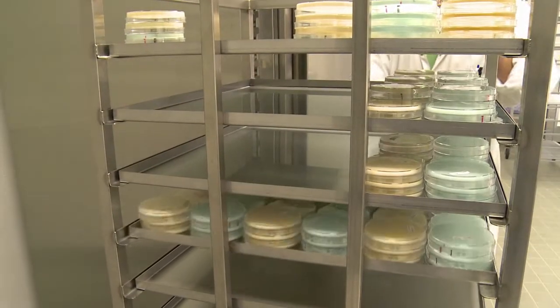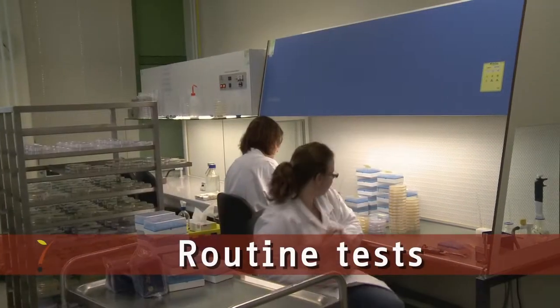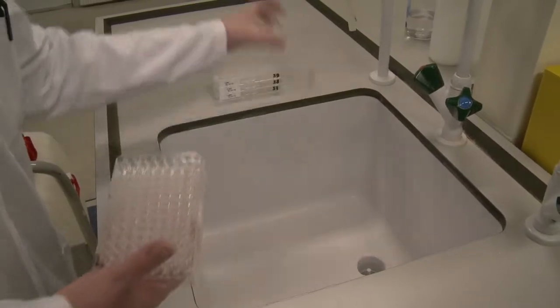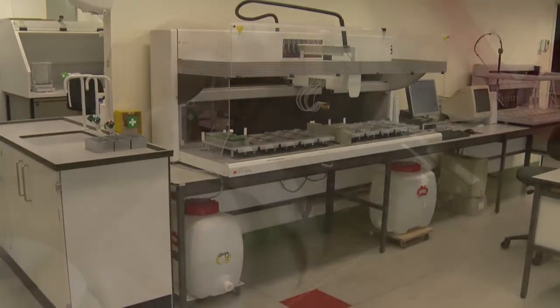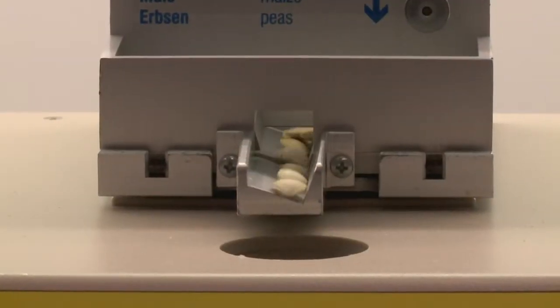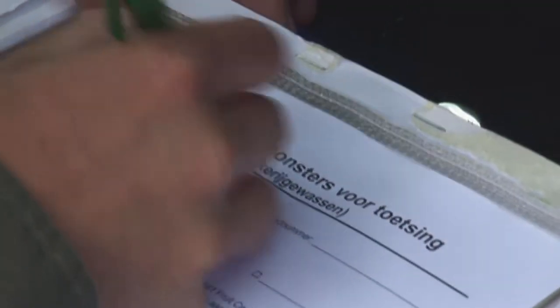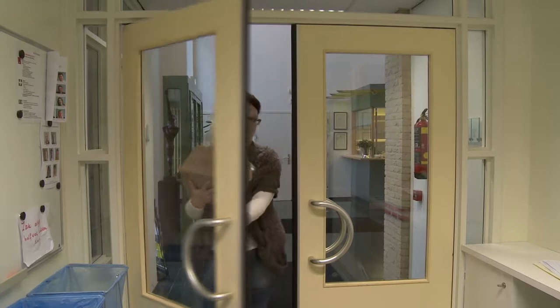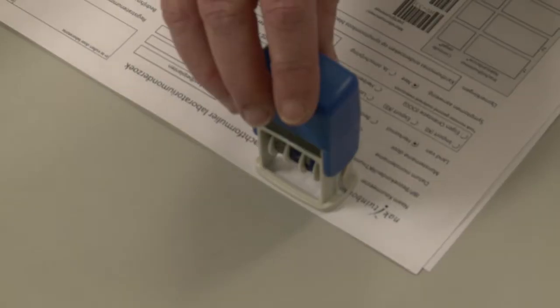Part of the laboratories at Naktuinbouw is dedicated to routine testing of the health of seeds and plant material. Naktuinbouw conducts laboratory tests to see if this propagating material is free of diseases. Focus is on large-scale testing on bacteria, fungi and viruses. Naktuinbouw inspectors and individual companies send samples, which can be for instance seeds, leaves or other parts of a plant, to Naktuinbouw Laboratories.